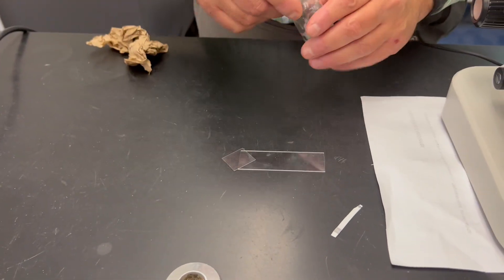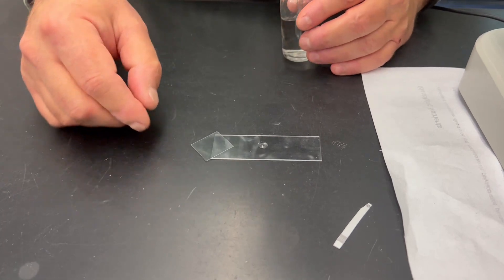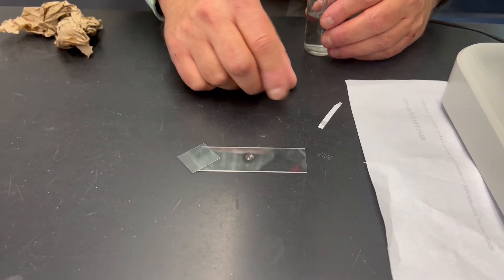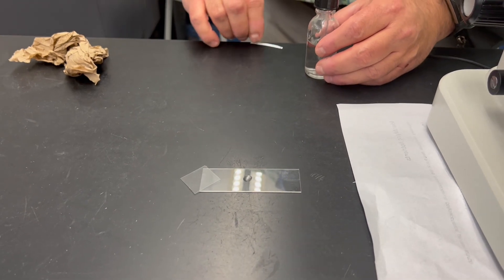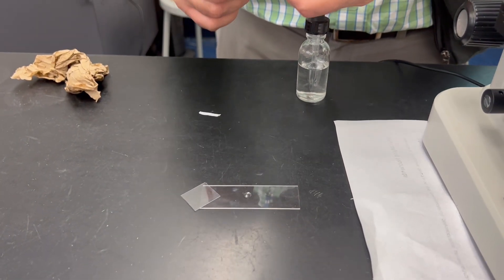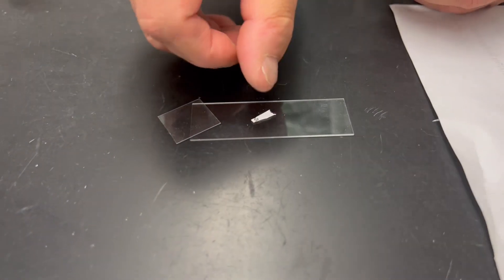What I'm going to do is place a little drop — a little dab of water on a slide — right in the center of the slide. We don't want our fingerprints all over it because they'll get in the way. So I'm going to add this letter E on here and cut it a little shorter.